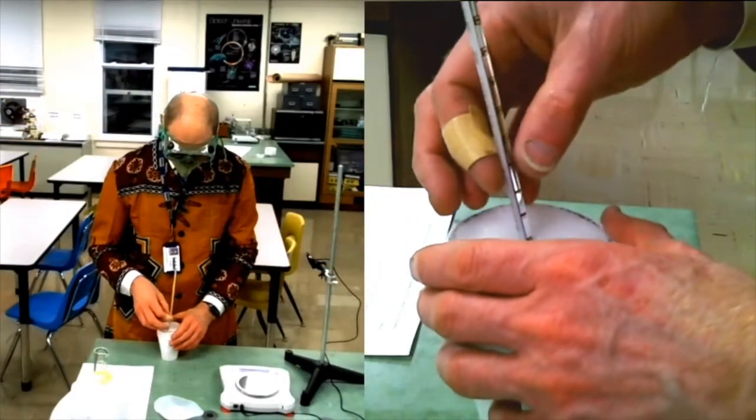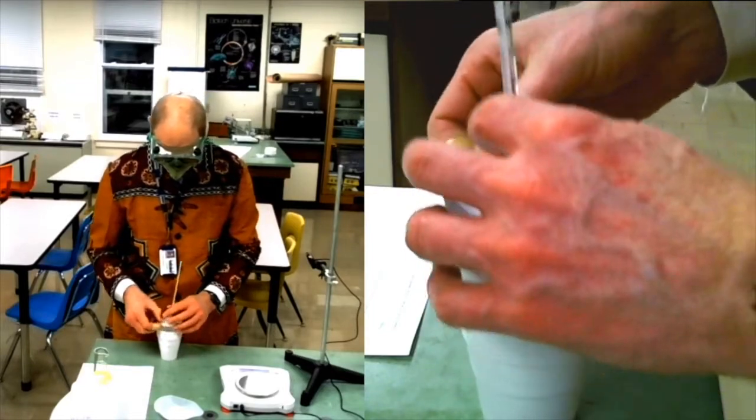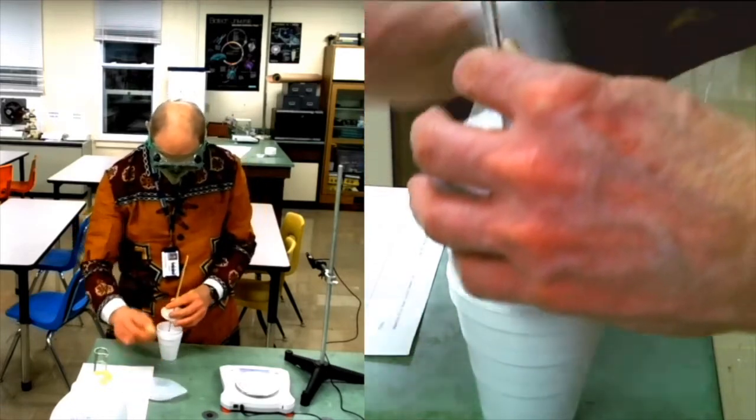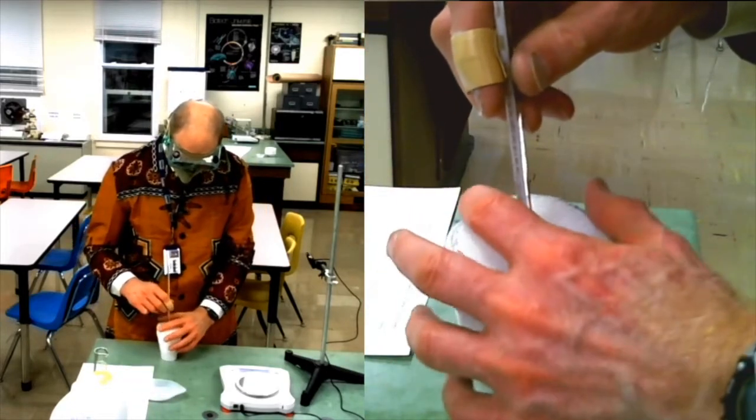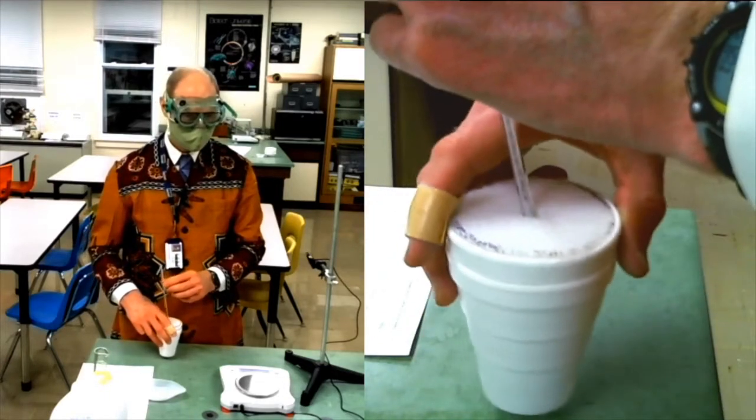Now to carry out the reaction. Add the salt. Put the thermometer back in. Swirl it to dissolve.